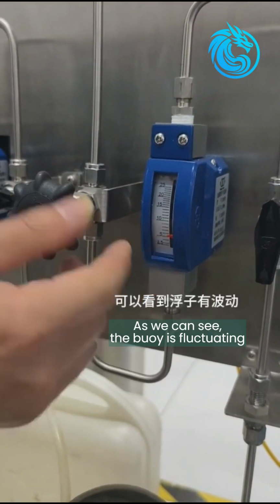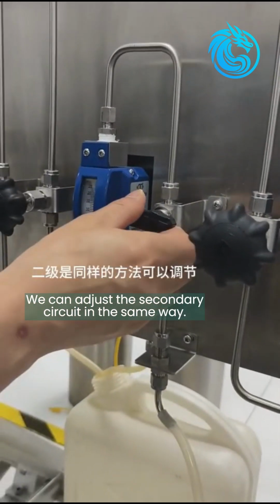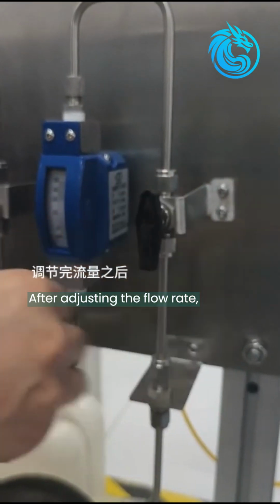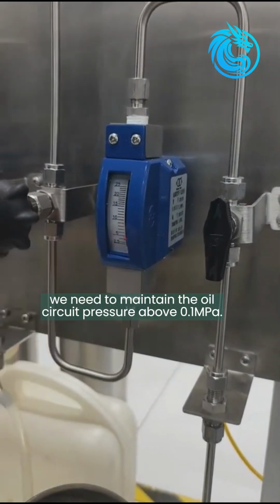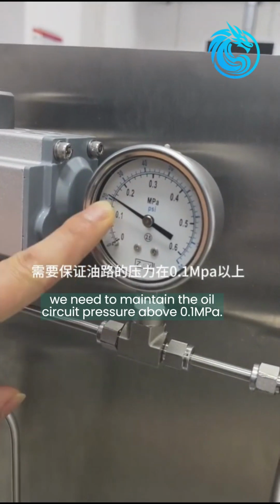As we can see, the buoy is fluctuating. We can adjust the secondary circuit in the same way. After adjusting the flow rate, we need to maintain the oil circuit pressure above 0.1 megapascal.